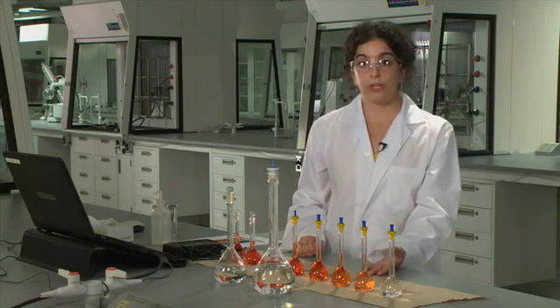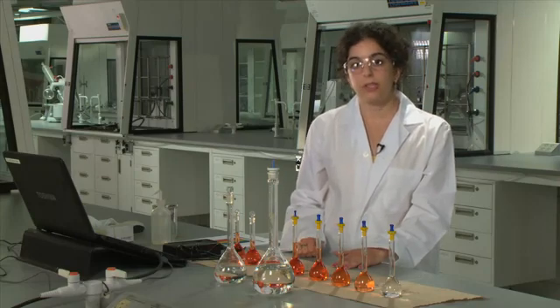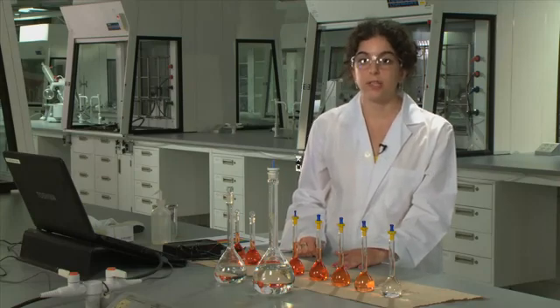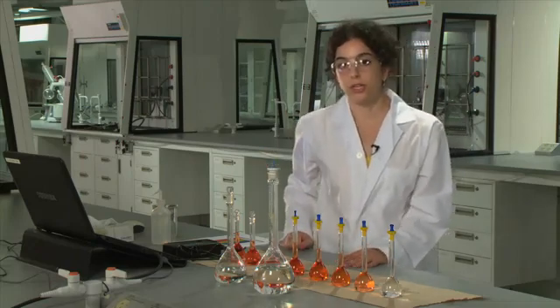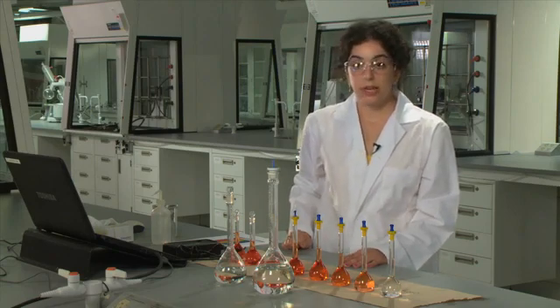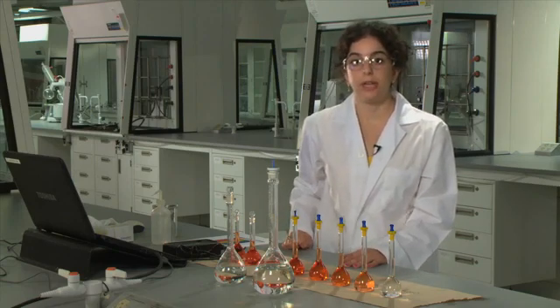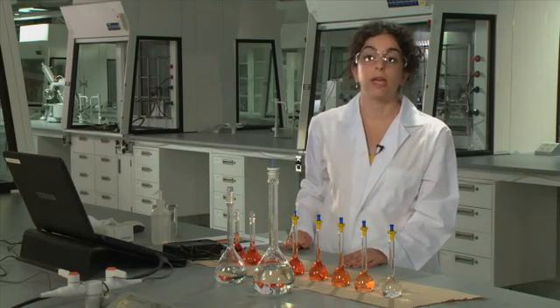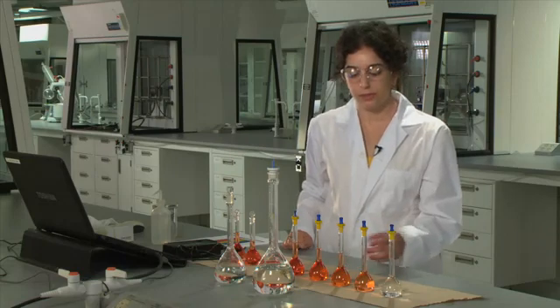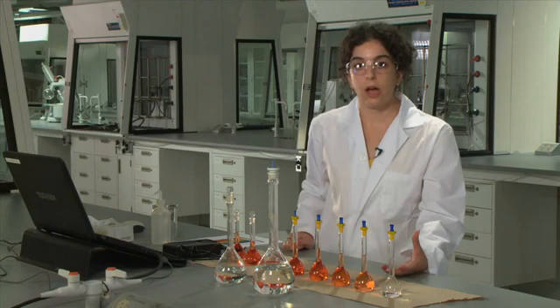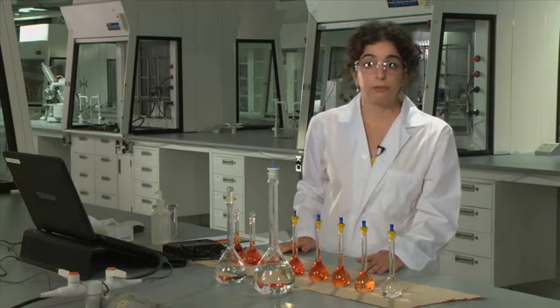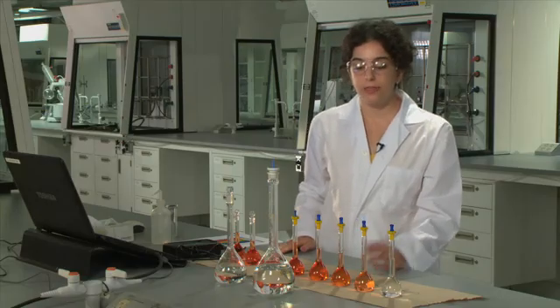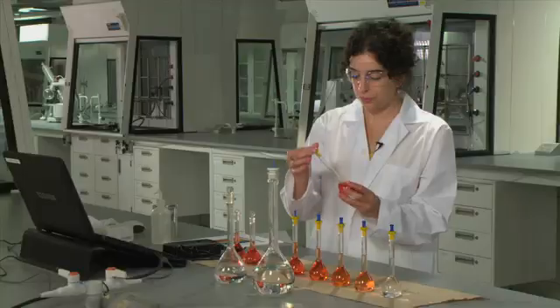The first ingredient that you're going to add is hydroxylamine hydrochloride, and this is a reducing agent that takes the iron from your standard solution in the 3+ oxidation state down to the 2+ oxidation state. The second reagent that you'll add is ortho-phenanthroline, which will react with the iron 2+ and form a colored complex, and the color being orange, as you can see here. You'll let those ingredients react for about 10 minutes, and then you will dilute them to the mark with distilled water.